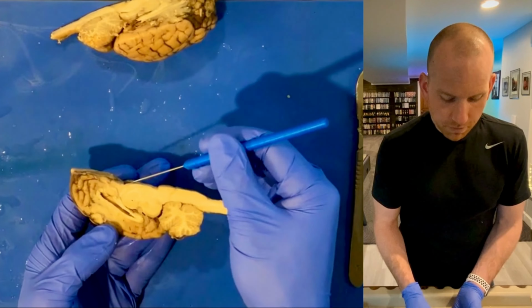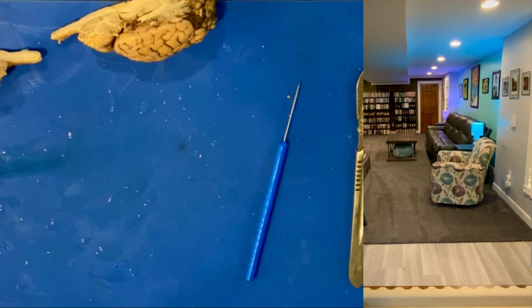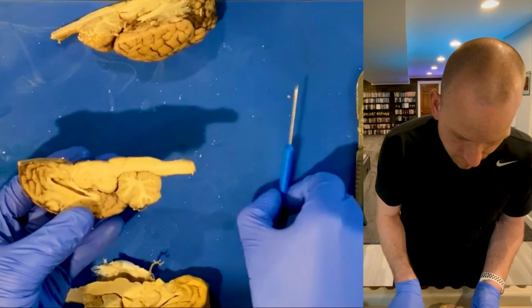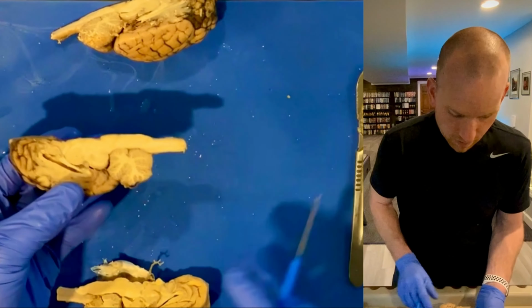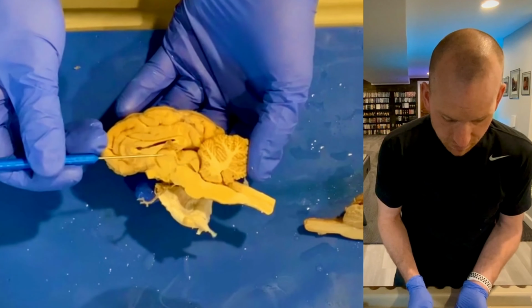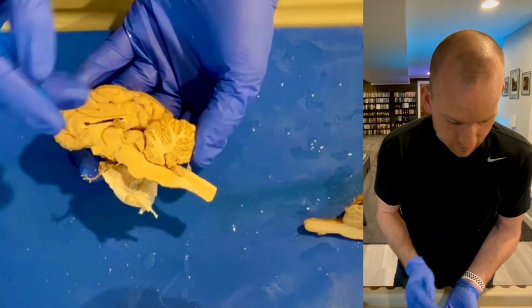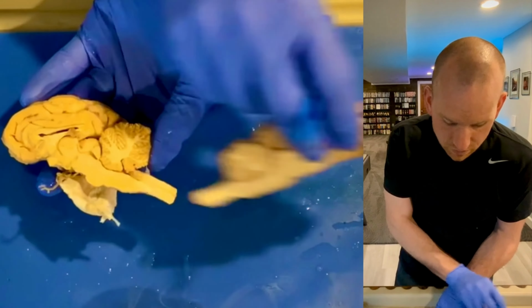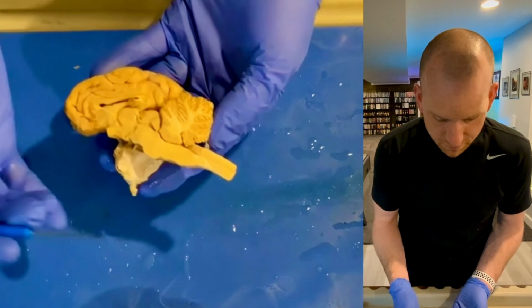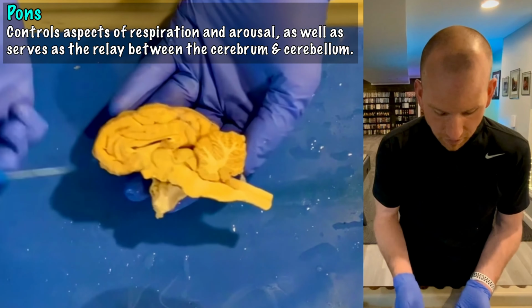Now, again, I'm a little bummed. I'm going to see if I can show you on another brain piece over here. Oh, yes, I can. Okay. So on the one that I was just holding up, there's no little bump on the bottom because we didn't have it intact, but this one looks great. This thalamus, by the way, looks really great on this one too, and you can clearly see the white and gray matter of the cerebellum on this one. I think the one that I just dissected, you could easily see that too, but this one has just a little bit more definition. And the definition, by the way, in the pons is just extraordinary. Look at that pons on this one.